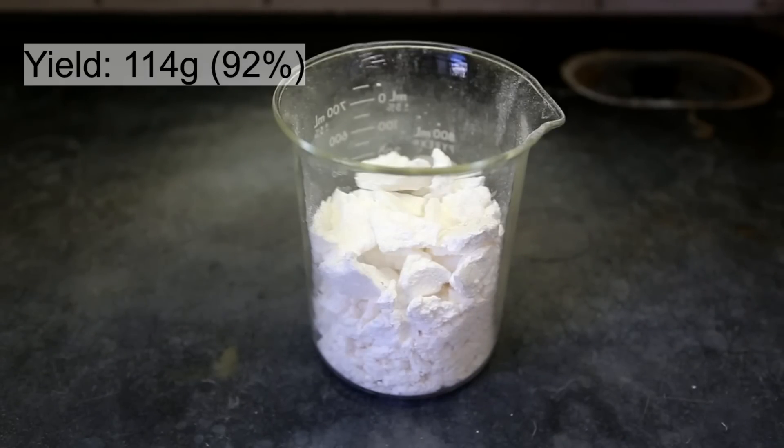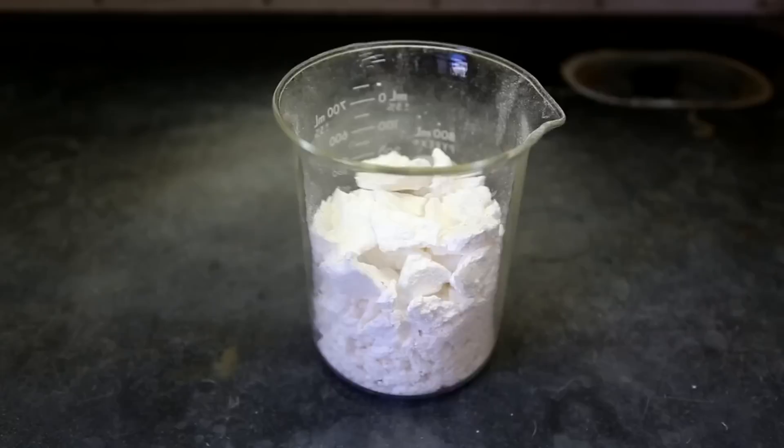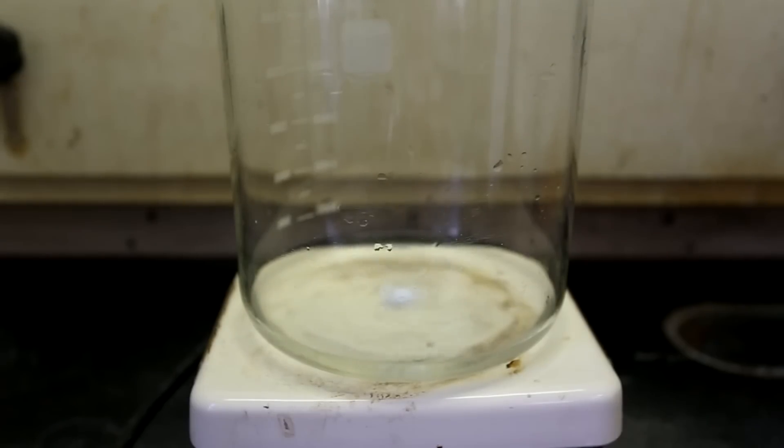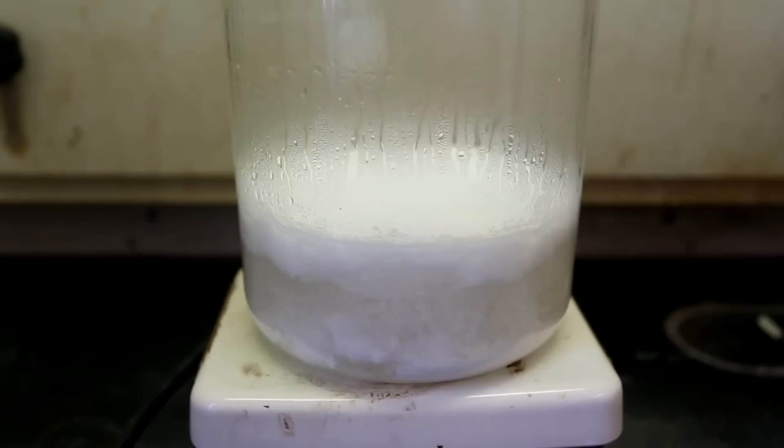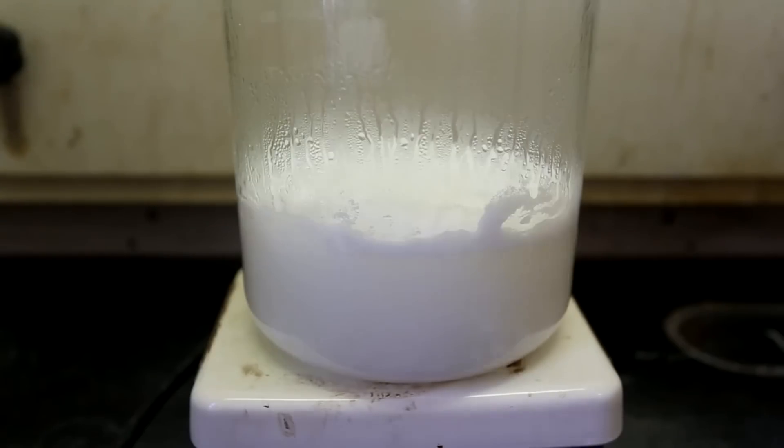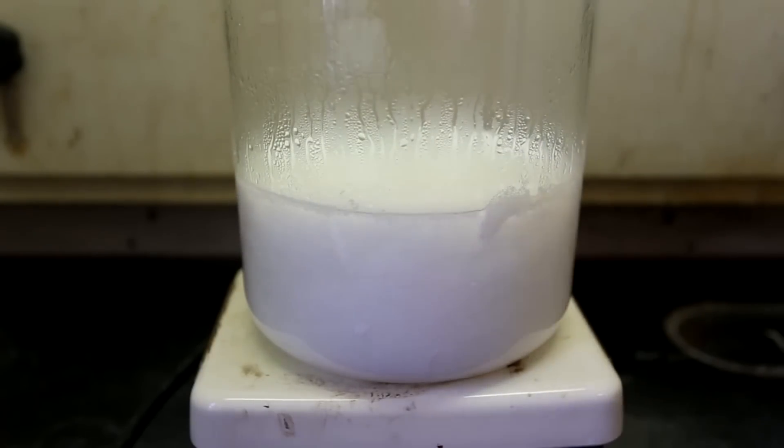However, because I didn't use enough water to wash the product when I was filtering it, there was still a little bit of hydrochloric acid left over that you could smell. I carried out a recrystallization but I really do not think it was worth the time. Again, just wash your filtered product in the Buchner funnel with a generous amount of water and you should be able to completely skip this.